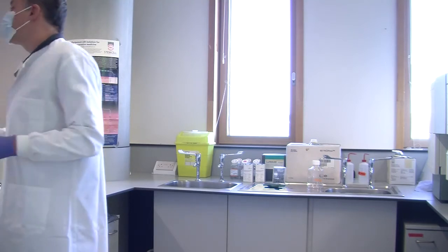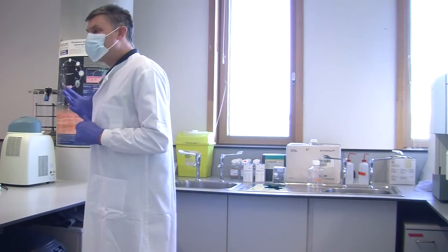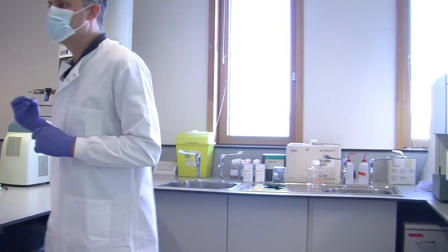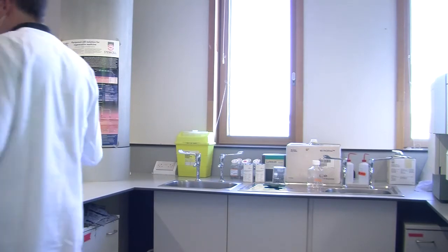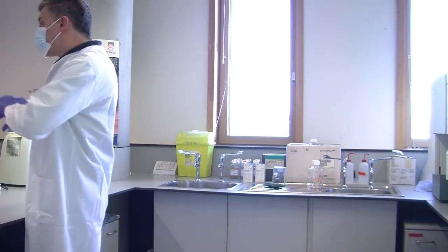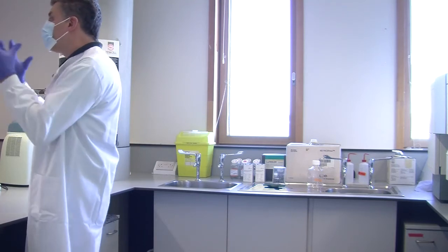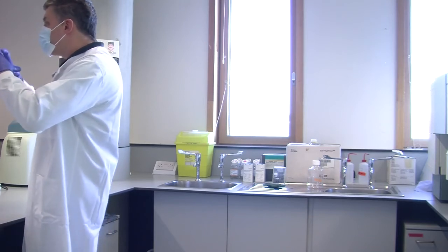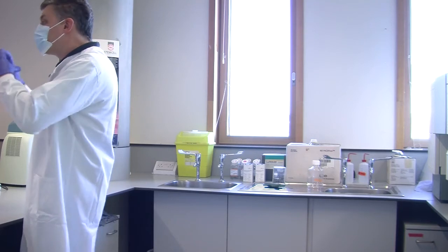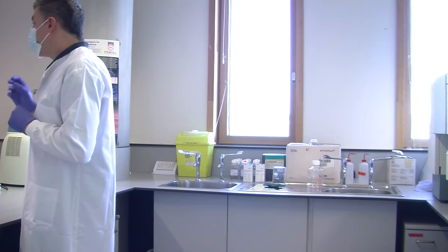Right, so the fixative we're adding now, is it PFA? It may not even say, but I think it's probably PFA, paraformaldehyde. What this does is it cross-links the proteins on the cell surface. So it forms a scaffold between all the cell surface proteins. That then makes the cell very rigid, very solid, and it stops it falling apart, because the other component of this buffer is a permeabilization agent.